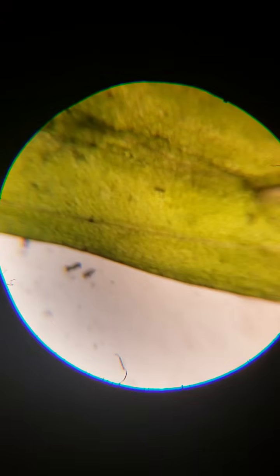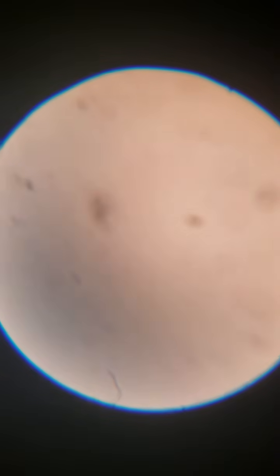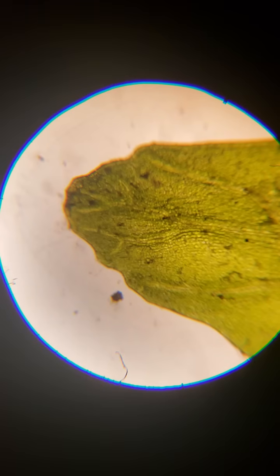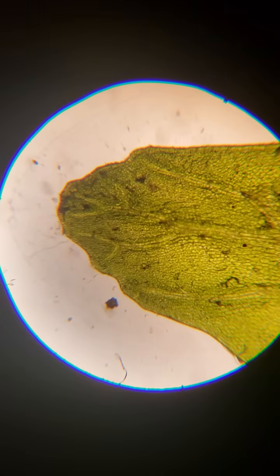So, pretty cool. Then there's also the main runway in between all that, and you get these veins that water and nutrients move through the plant with. But even when you're not that zoomed in, you can tell, oh, that is definitely a plant cell. But look at that, you see the dendritic patterning.